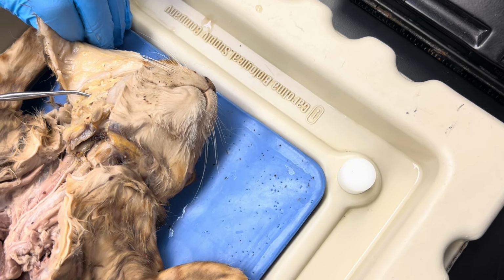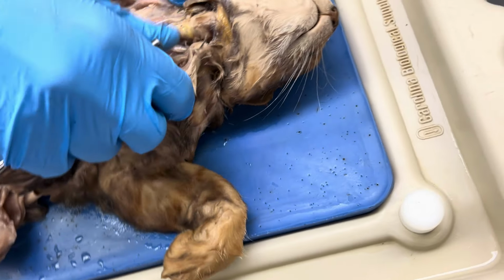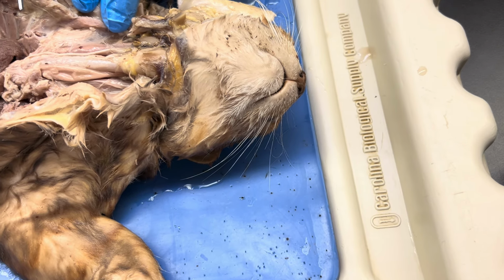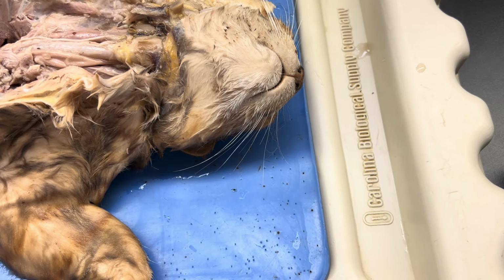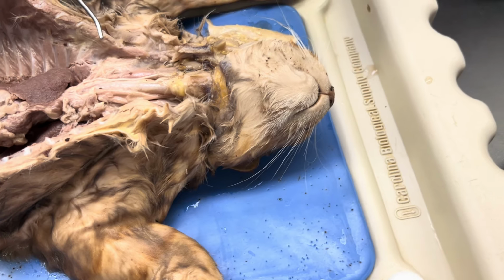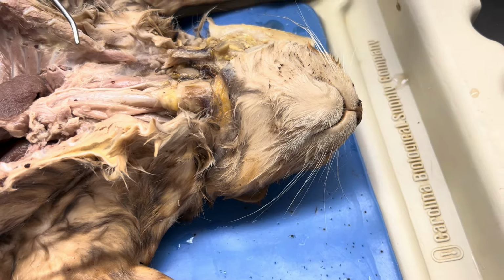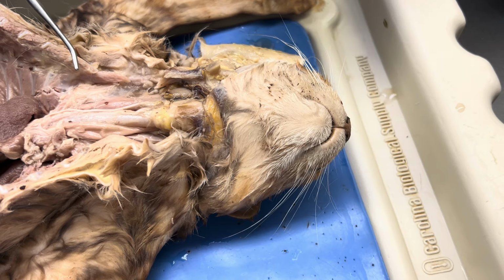All right, next up we have the esophagus. So we have to come toward the midline of the neck, okay? And next week we'll talk about the respiratory system. There's a tube of the respiratory system called the trachea. You do have that on your list, so I'm gonna show you that first because it's actually more superficial. The esophagus is located behind it.